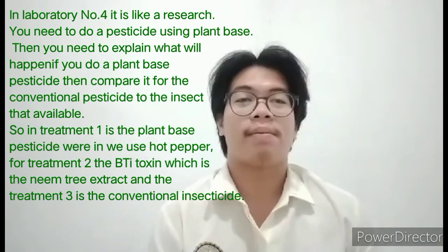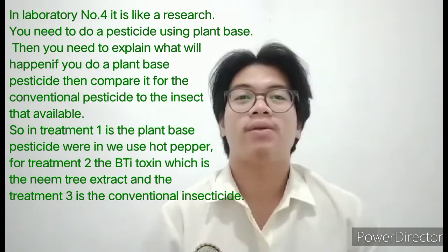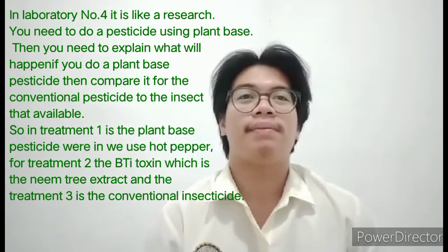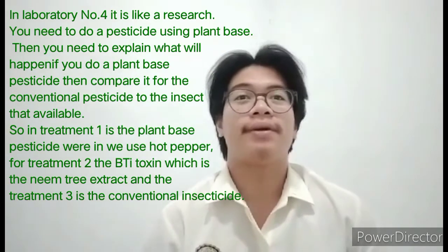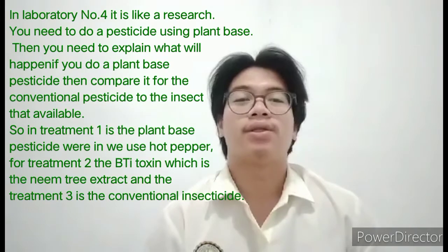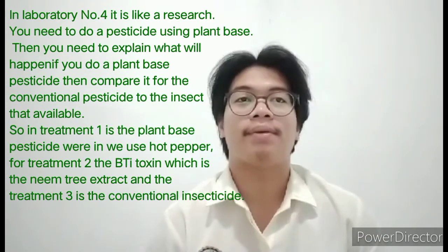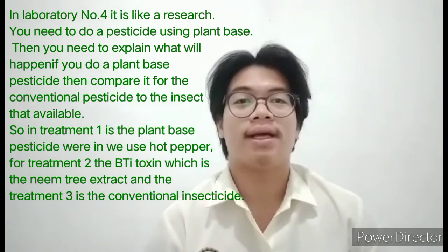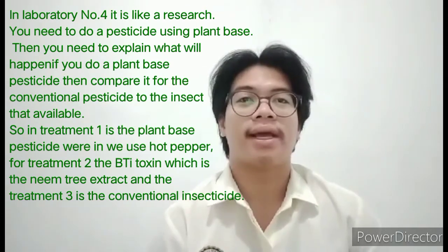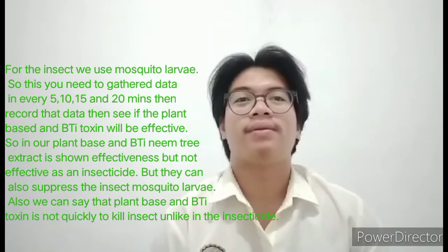In laboratory number 4, it is like a research. You need to make a pesticide using plant-based materials, then explain what will happen if you do, then compare it with the available treatments on the insect. So, treatment 1 is the plant-based pesticide, wherein we use hot pepper. Treatment 2 is the BTI toxin, which is the neem tree extract. And treatment 3 is the conventional insecticide. For the insect, we use mosquito larvae.